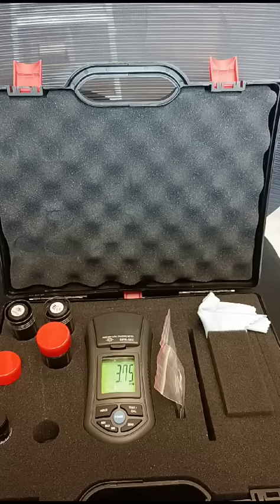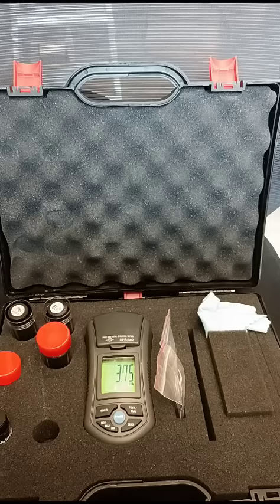Okay, this is the free chlorine reading in this testing bottle. You can make the same process for total chlorine. Thank you.